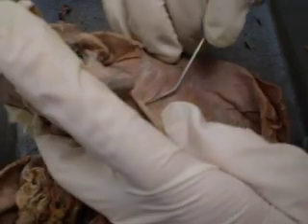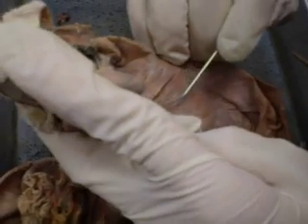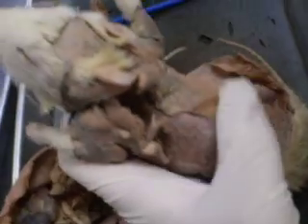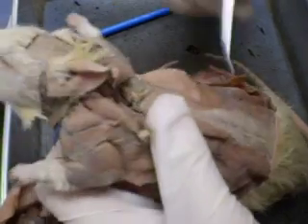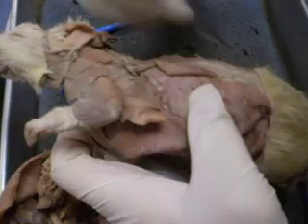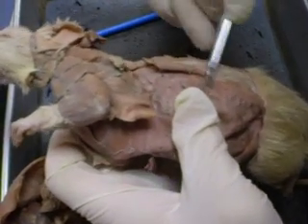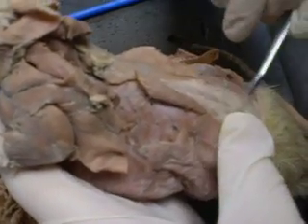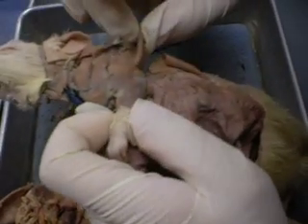And then you have your serratus dorsalis, serratus ventralis, and then what else is there? You have your thoracic trapezius. This is your thoracolumbar fascia. Underneath it is your aponeurosis. The muscles underneath, over here related all alongside to it, will be your erector spinae. Over here's your whole thoracic trapezius, right?